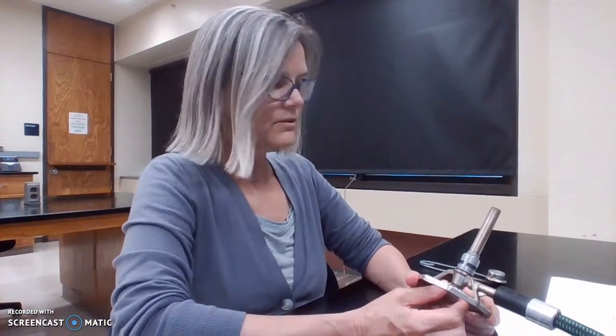What you can see is with our Bunsen burner, we have at the bottom a needle valve. That needle valve is going to control how much gas goes into the Bunsen burner, and that's going to control the height of the flame. I like to turn it over this way, and if I turn it right, I got righty-tighty, lefty-loosey. If I do it this way, I kind of forget which way is open and closed. So here I go righty-tighty, that's closed.